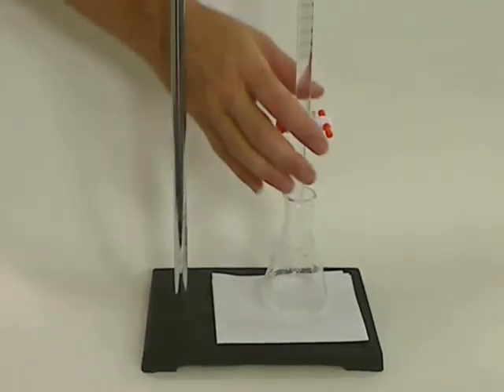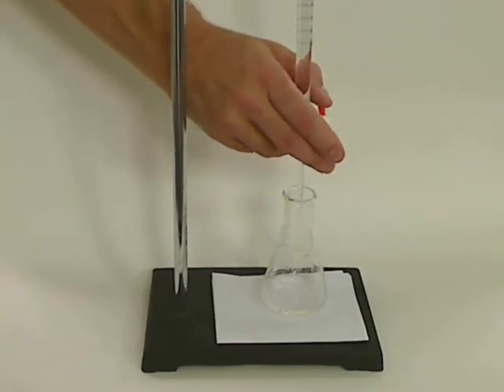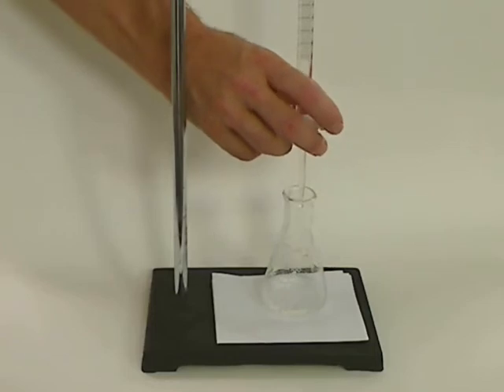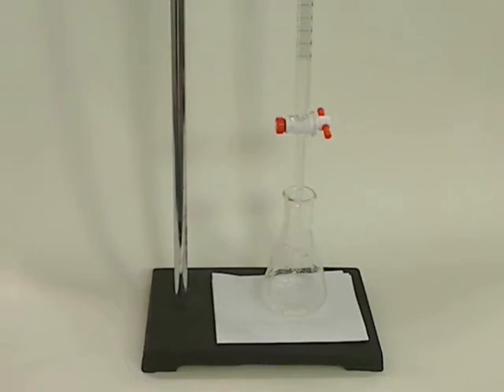When you're looking at the stopcock, make sure it's not too loose and not too tight. You want to be able to turn it very easily, but not too easily, and also be able to get a single drop to come out. That's also very important.